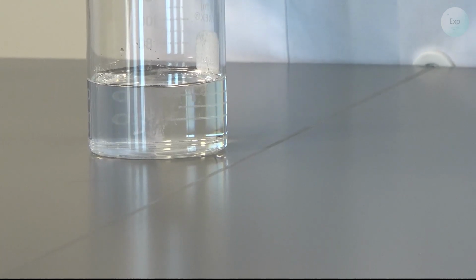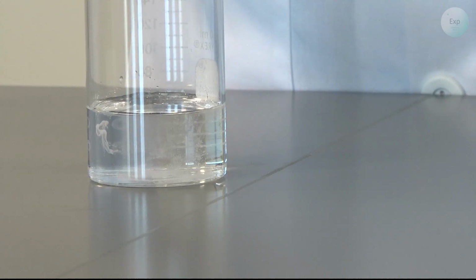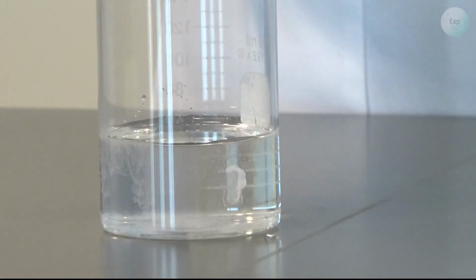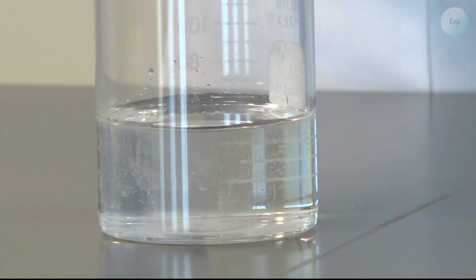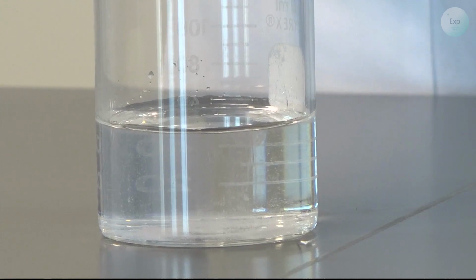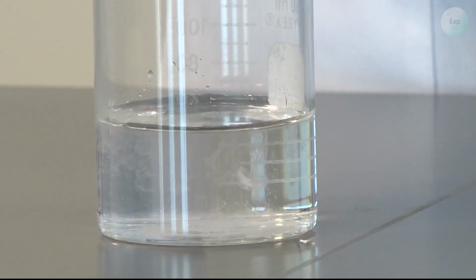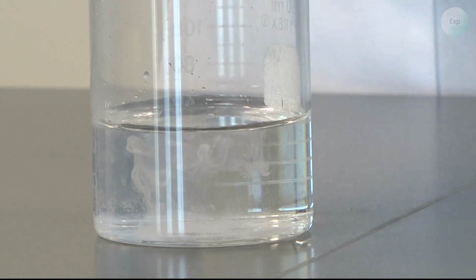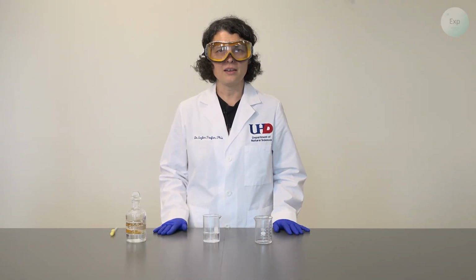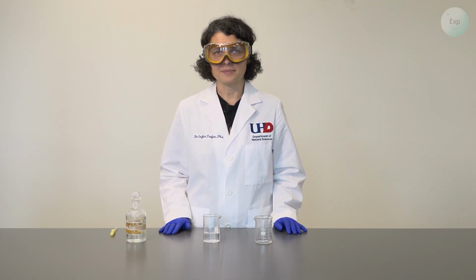The additional chloride ions that are added should cause the sodium chloride to precipitate from this solution. And so you can see the formation of sodium chloride, but you see it in very, very small particles and not the grains of salt that we're familiar with. This addition is sufficient to observe the impact of the chloride as the common ion effect on the solubility of sodium chloride in water.